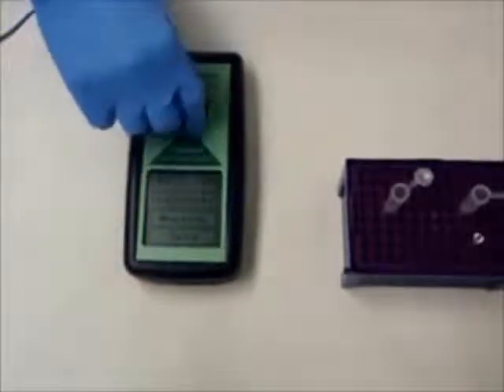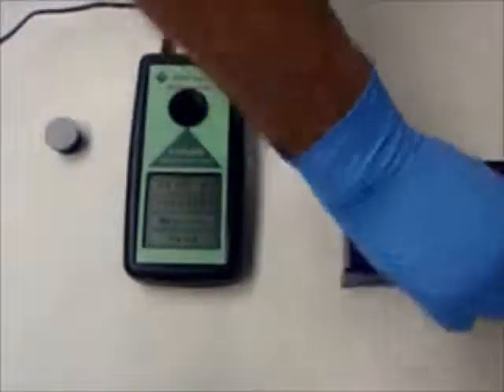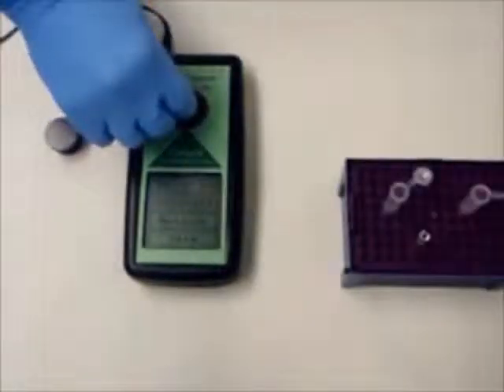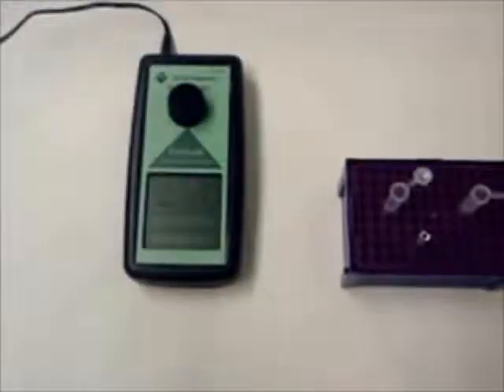Remove the control and place the sample small glass testing tube into the fluorometer test chamber and replace the cap. Push the measurement button on the touchscreen and record the result of the sample.